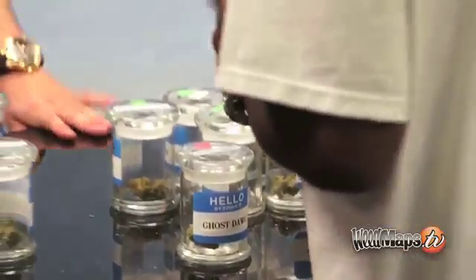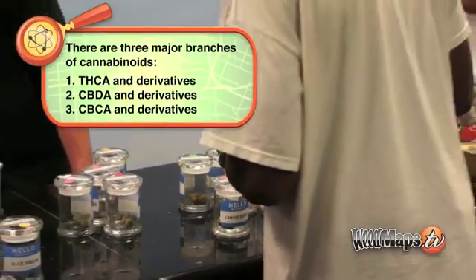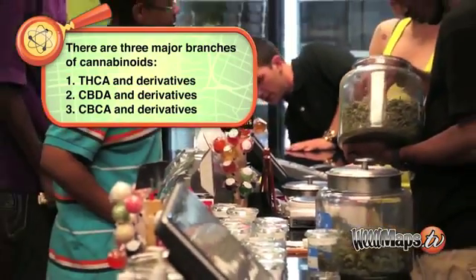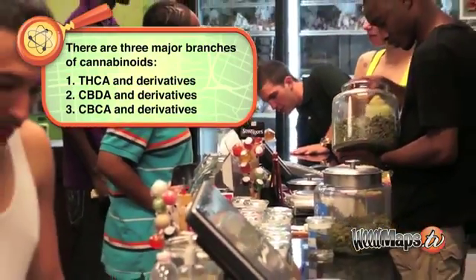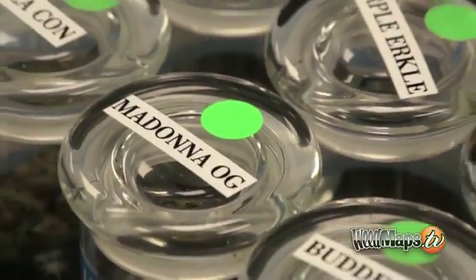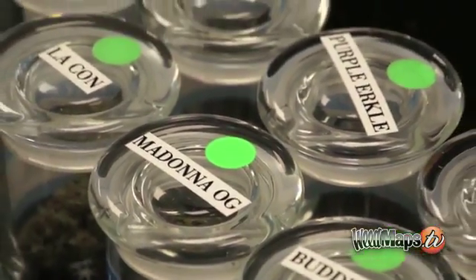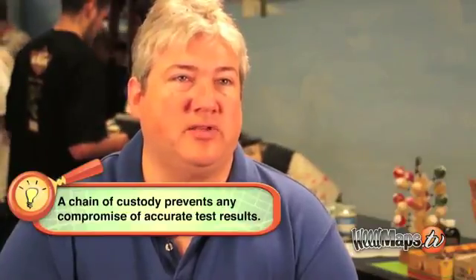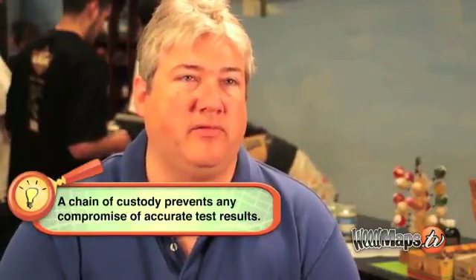The procedure obviously starts at the dispensary. We like to have our own couriers come to the site. We want to make sure that we get a representative sample and not just the best bud or the worst bud of a bunch. We make sure that an appropriate chain of custody is started there, which is critical. There's an ID tag number that goes along with that sample and follows it from beginning to end.